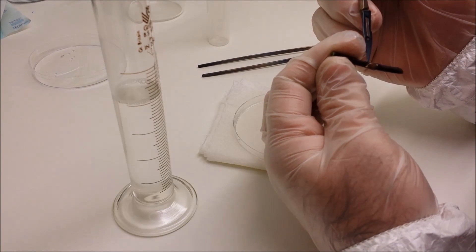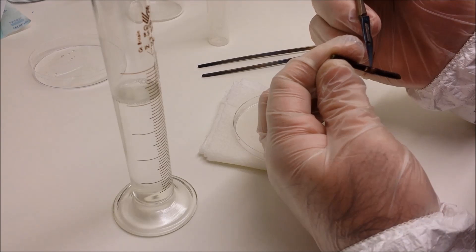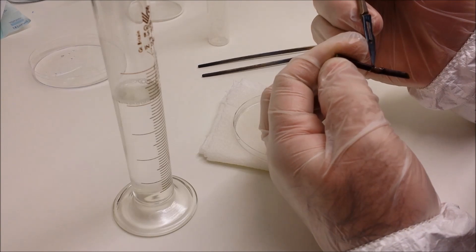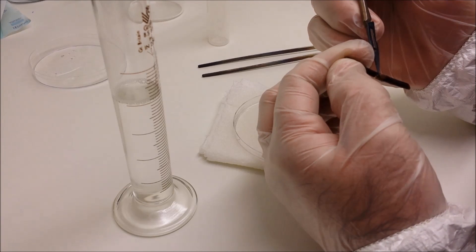And now what we're going to do with the sterilized scalpel is we're going to remove very carefully the bract covering the bud. It's a dormant bud that's underneath. Remember, this was far down on the flower stem, not one that's already produced a flower because that's already spent.